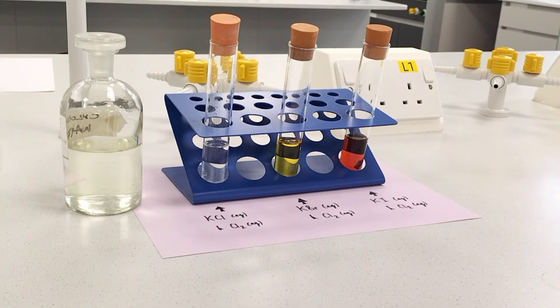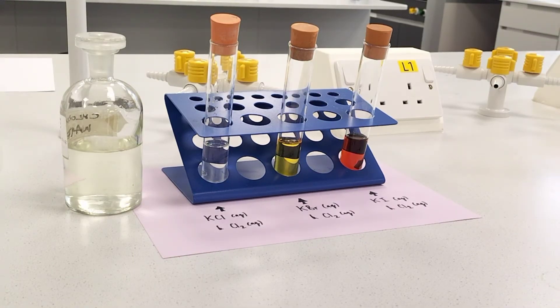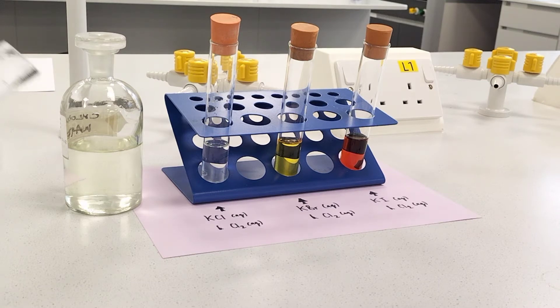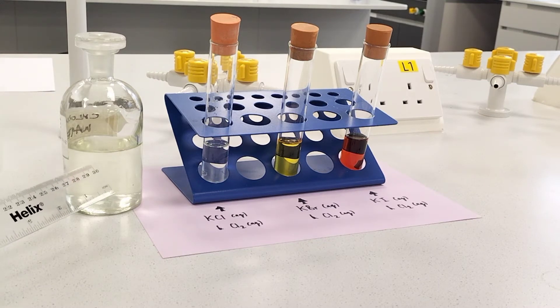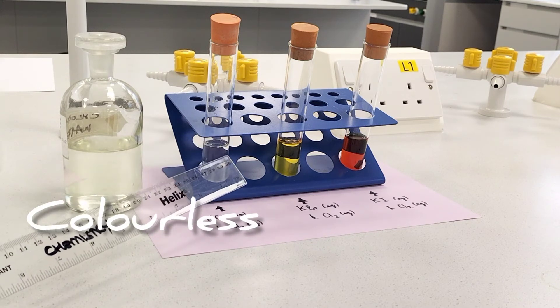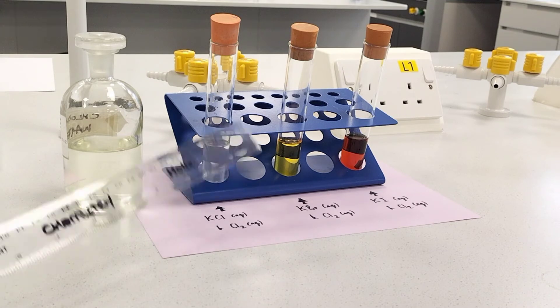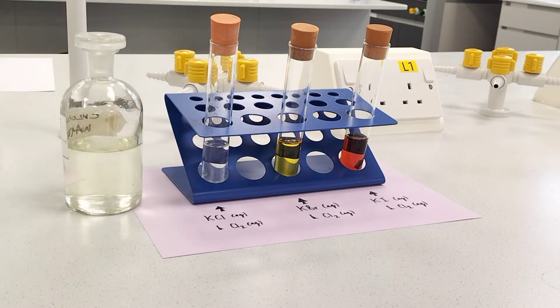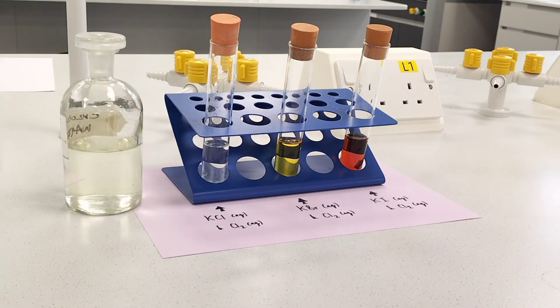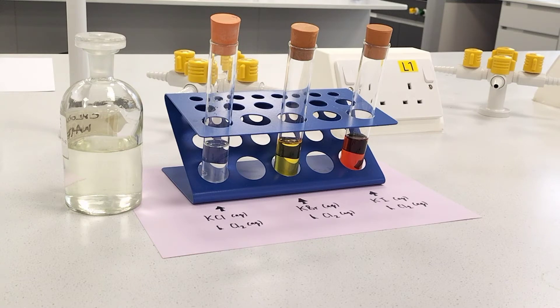Here is the aftermath once I've added the chlorine water to the three solutions. The chlorine water itself is effectively colourless. Upon addition of chlorine water to potassium chloride, it doesn't appear like anything's happened — that's because chlorine is as reactive as itself within the chloride solution, so there's no displacement reaction.